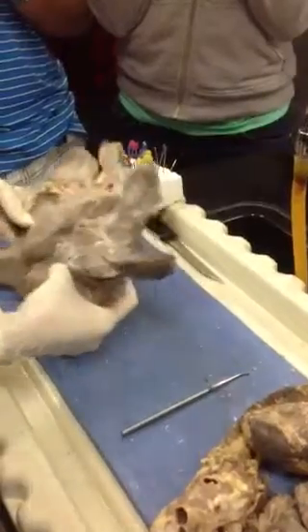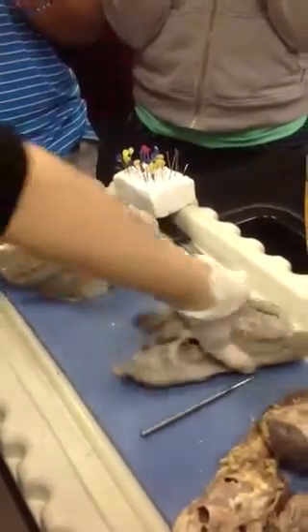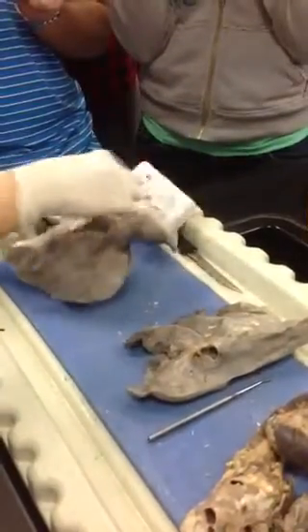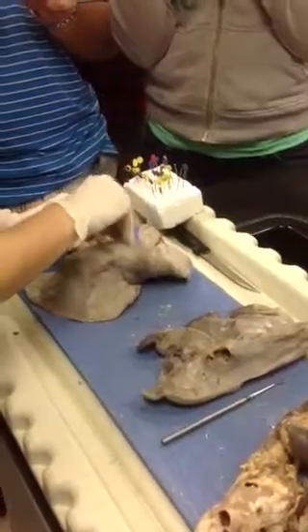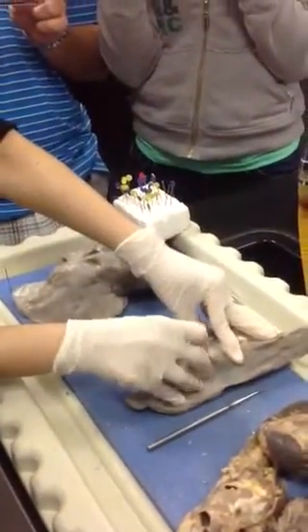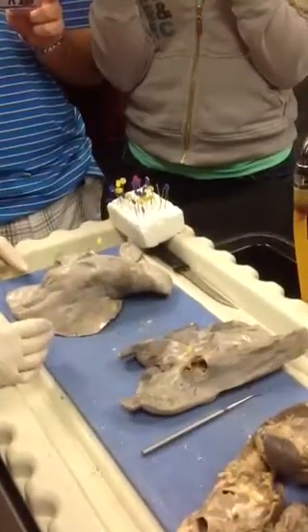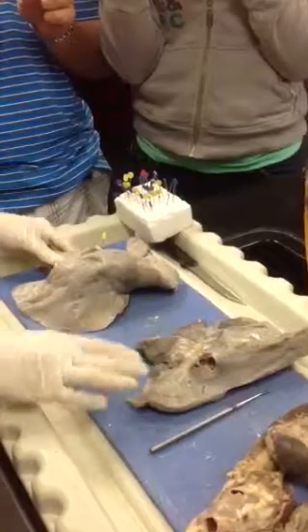Which one's prettier? Okay, so then, and I'll flip this so that you guys can see. Yellow, if you have a glove you can feel it too, is what structure? Primary bronchus. Primary bronchus, right?